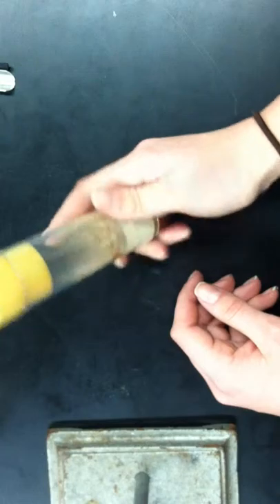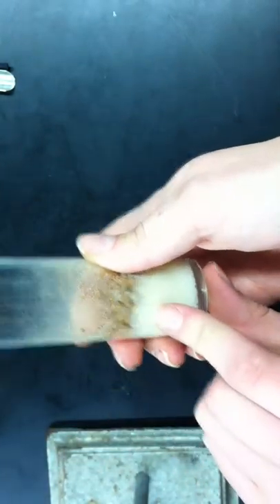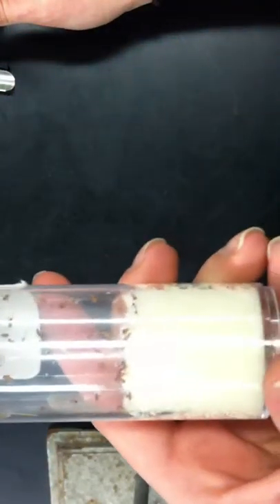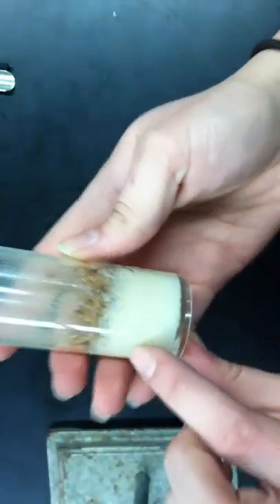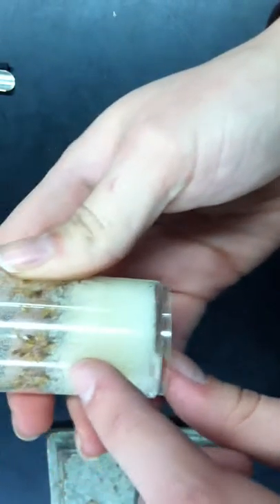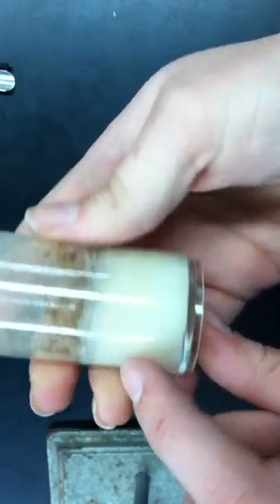So to start off, you have your fecund culture that you let sit for a few days. You know it's fecund when you see all the pupa and larva. You transfer the adults to here, so you can see all the adults are here with fresh media, and there are no adults left in here, just the larva inside the media. You can see the tunneling. That means that there are larva present in the media.